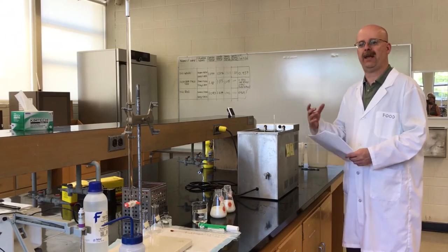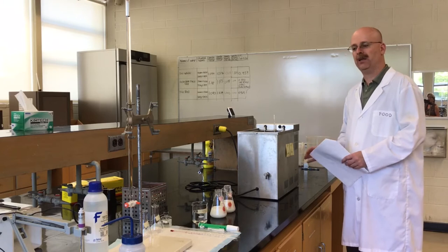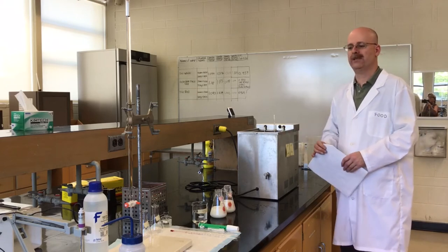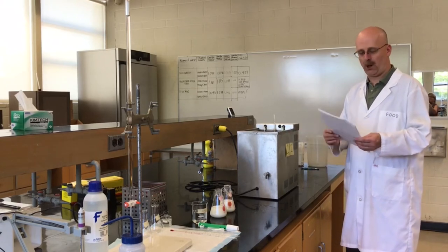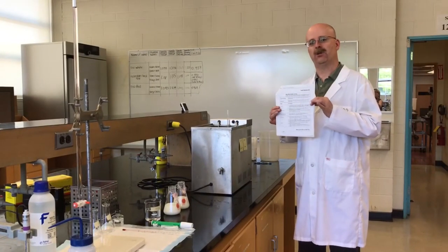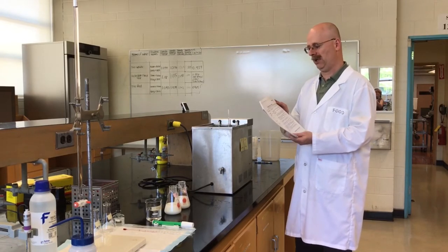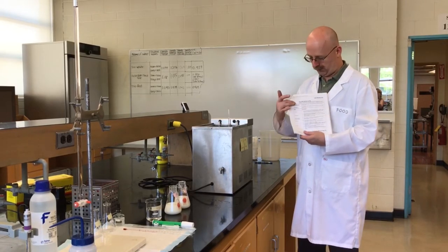Hi, my name is Ken and I'm going to be walking through the receiving of raw milk here. I'm going to be walking through a series of tests and we're going to be following section 5 that's available to you. Specifically, for this section that we're doing here, it is going to be lab station number three.